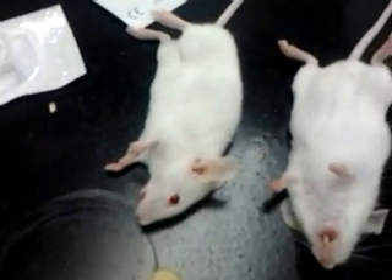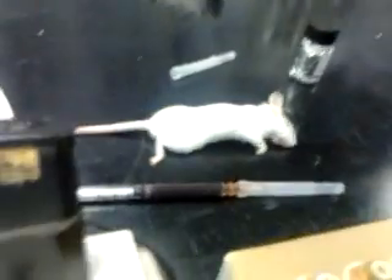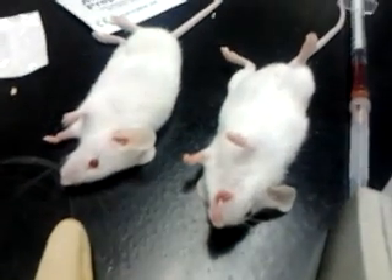Or else you have somebody to help you to fold, then you pull the muscle. The dosage is 0.1 ml per 200 grams. Yes, 0.1 ml per 200 grams. So what I want — one of the most important things — yes, you each choose one.